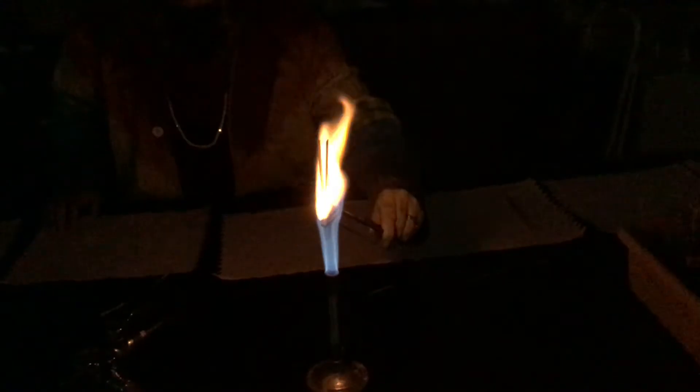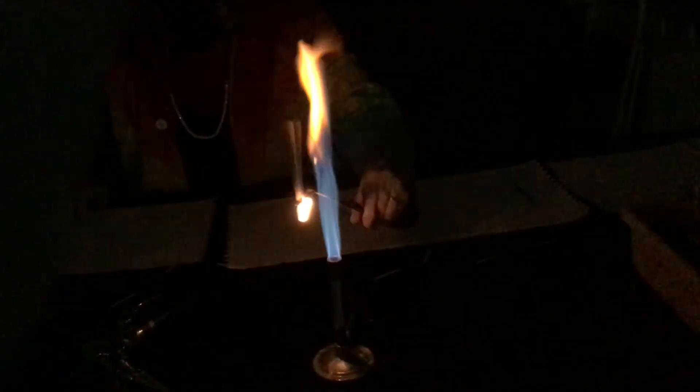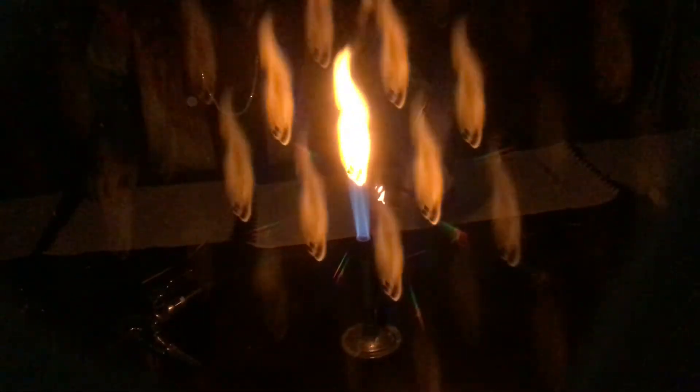Now you're going to take the unknowns. Be aware, there's probably more than one sample for each unknown — it's not going to be just one. So you're going to be looking for more than one color. This is unknown number one. This is unknown number two.